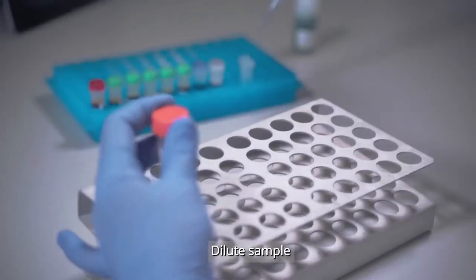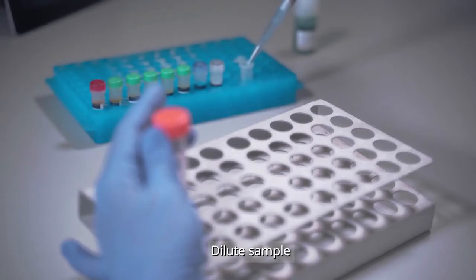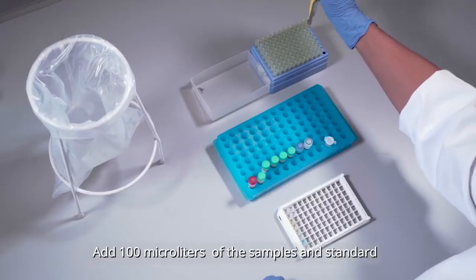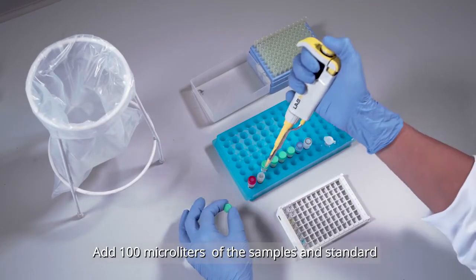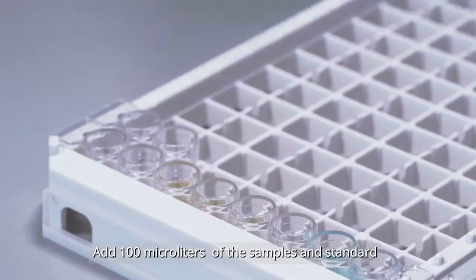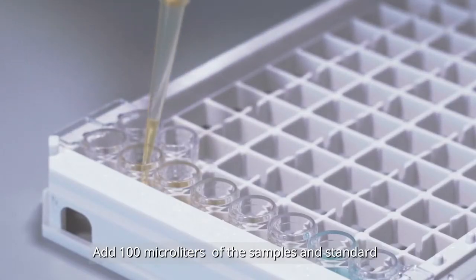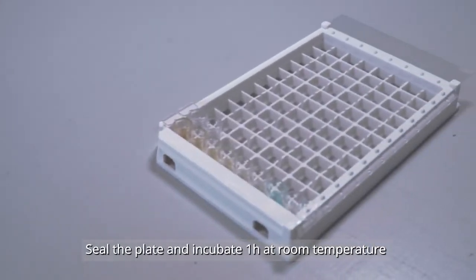Dilute the sample and now you can start to run the test. Add 100 microliters of the samples and standards into the plates. Seal the plate and incubate one hour at room temperature.